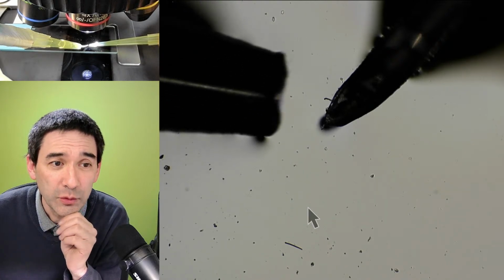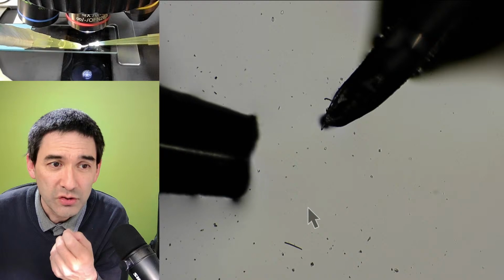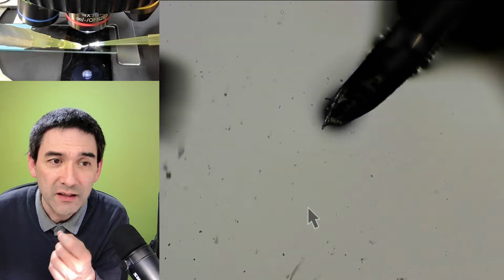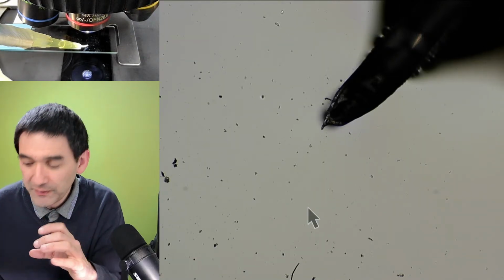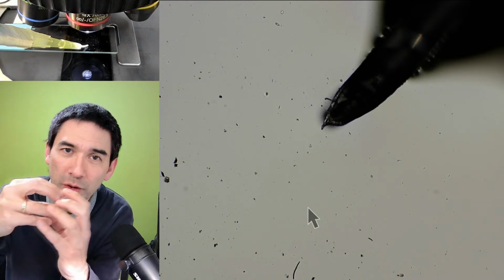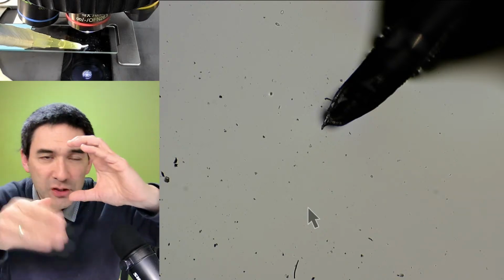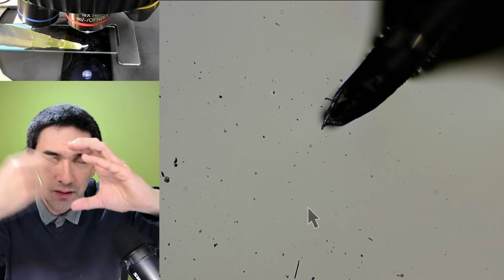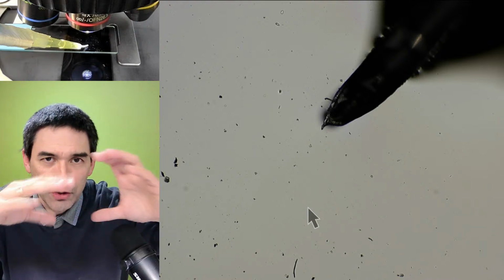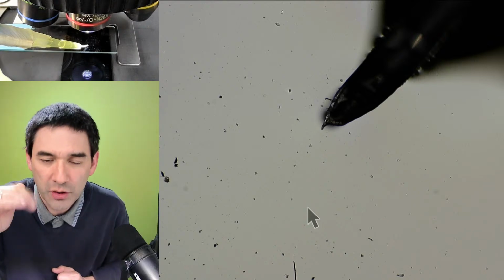And I will tell you what the problem is if the diameter is too thick. It's not only that you're sucking in too much, that's not so much the issue. Most likely you're not able to suck in anything at all, and the reason is that if half of the opening of the tip is not covered with water, but in air, then you're not able to suck in any water, right? If your tip is this huge, then everything has to be covered in water so that you're actually able to suck in the liquid, and therefore the droplet of water has to be very large. So you have to make it smaller, and then also the droplet can be much smaller.